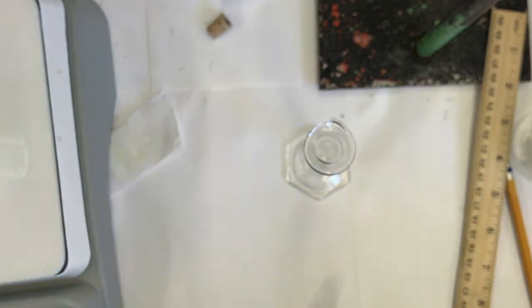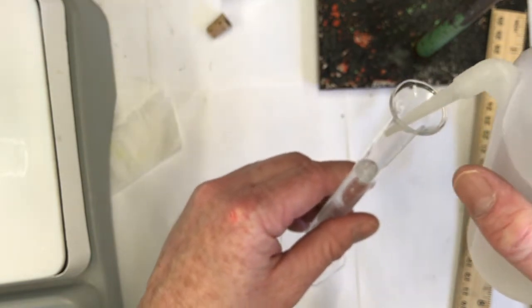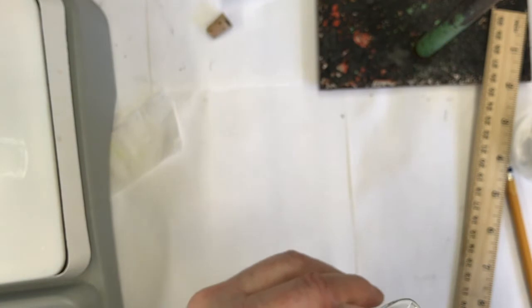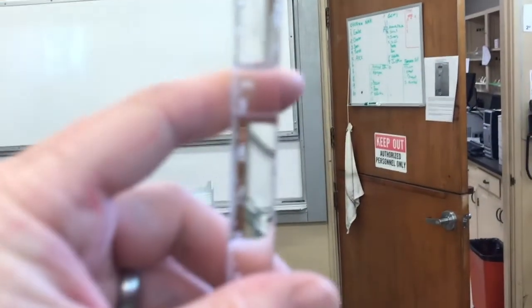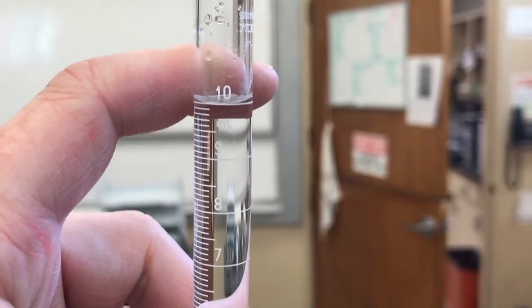So I've got my methanol in there first, 8 milliliters. Now I just add DI water to 10 milliliters. I think I'm good. Oh, a little more drop. Is that good? Yeah, I think that's pretty good. What do you think? It's bubbling a little bit. Whenever you mix solvents, it's exothermic and generates a little heat. My goodness, this will not focus, will it? There it is. It's at about 10 milliliters. The meniscus is about 10.